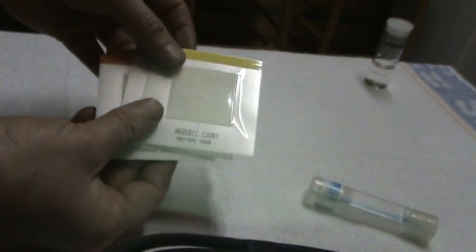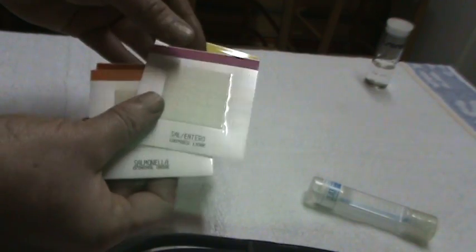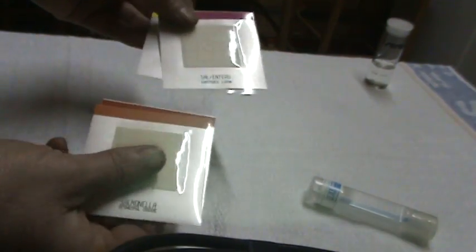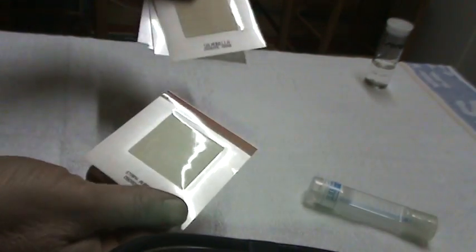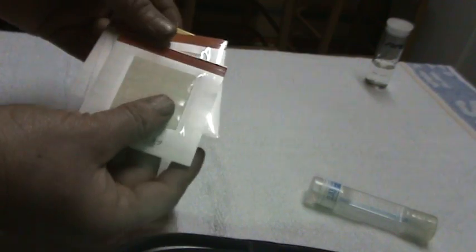Now I've just made four slides: one, two, three, and four. I'm going to place them in a bacteria stove now, so I'll have to lift the camera again.